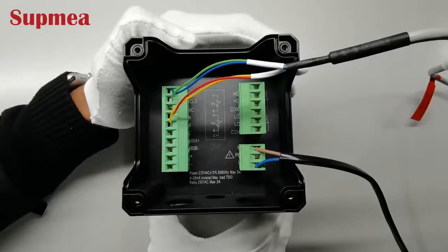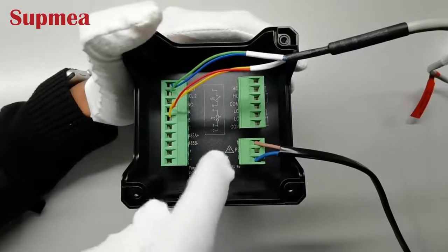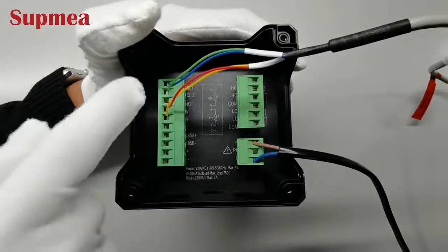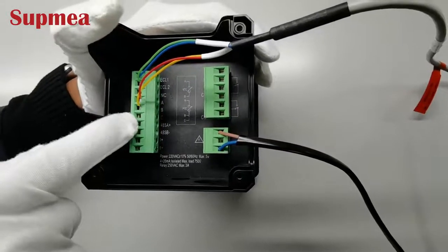And now, the sensor is already connected. But first, this is the power supply, the relays, the sensor, the temperature, the RS-485 communication, and then the 4 to 20 milliamps connection.